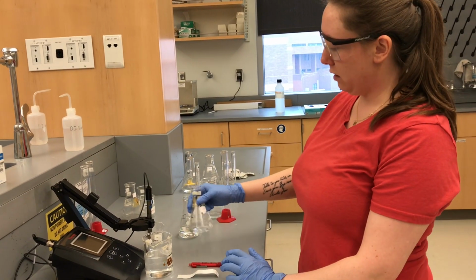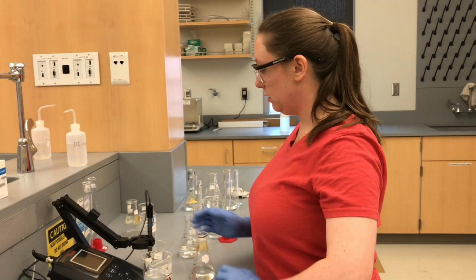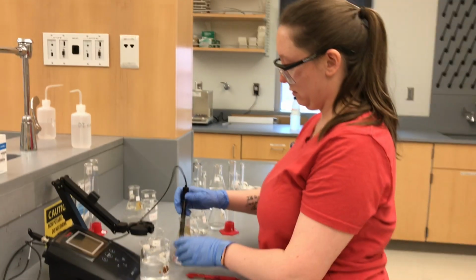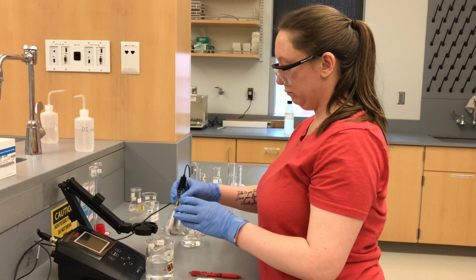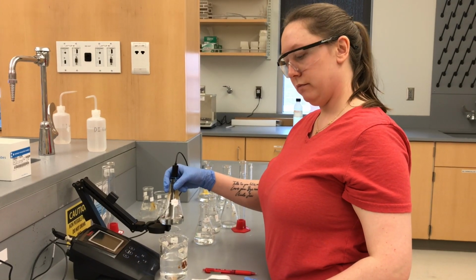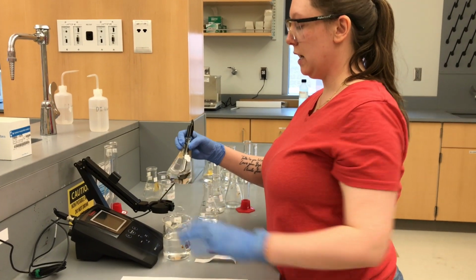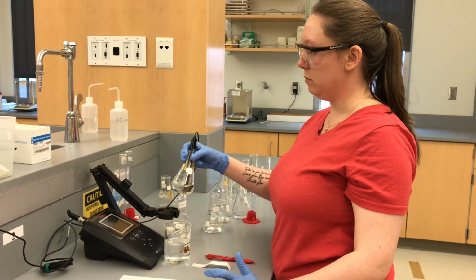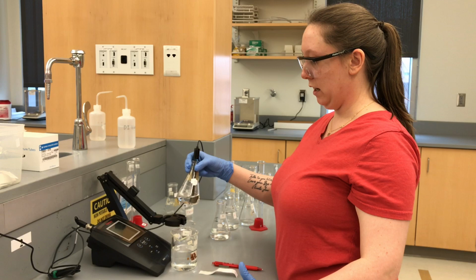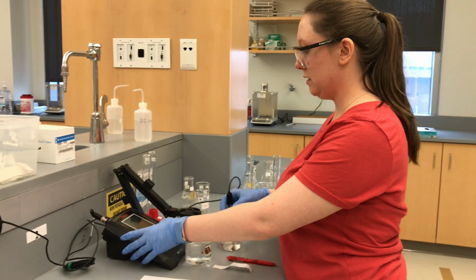So those go together. Alright, so this is F plus HCl, so this is our more dilute solution. Alright, so what's our new reading for F? Alright, so F plus HCl should be more acidic, so the pH should be going down. And our new reading for F plus HCl is 4.36.